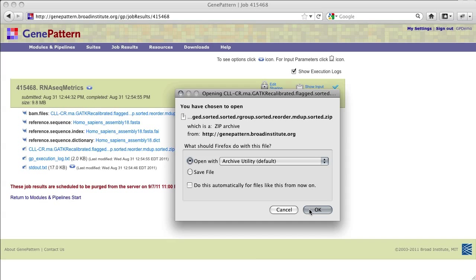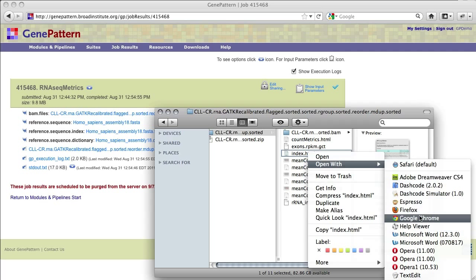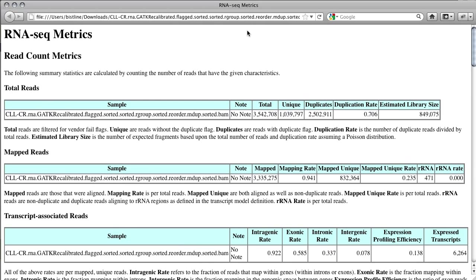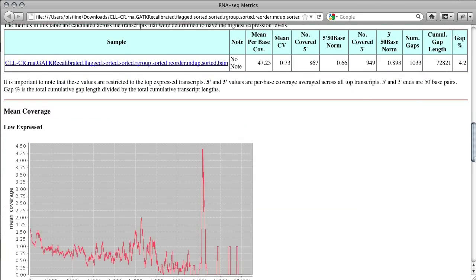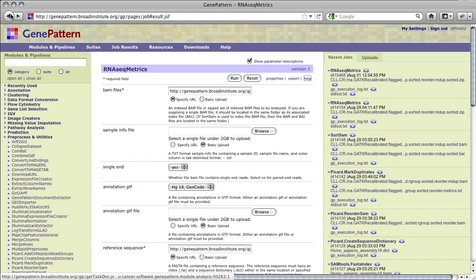To view the metrics, download the zip archive and unzip it. In the top-level directory, you'll find an index.html file. Opening this in a browser of your choosing will display a web page containing an HTML report of metrics, stating the total number of reads, depth of coverage at the 3' and 5' end, and more. The report also links to a GCT file containing the calculated RPKM values for each transcript in each sample, and coverage plots for the high, middle, and bottom expressed transcripts. Complete details on all of the metrics calculated are available in the module documentation, which can be accessed by clicking the Help link in the upper right-hand corner of the module page.